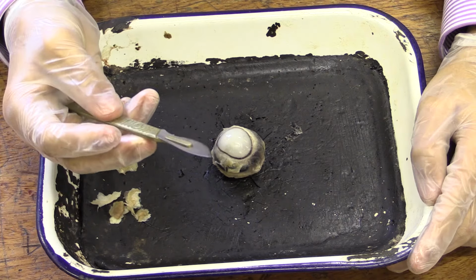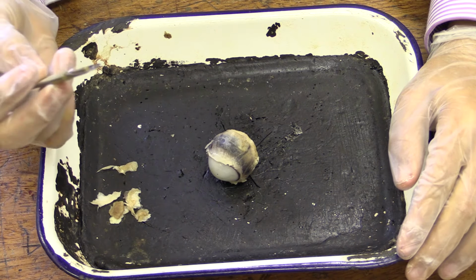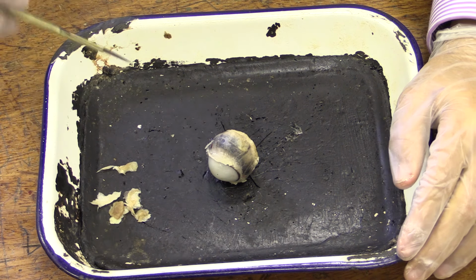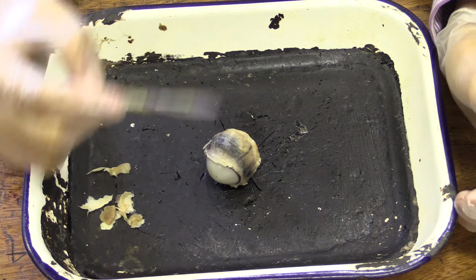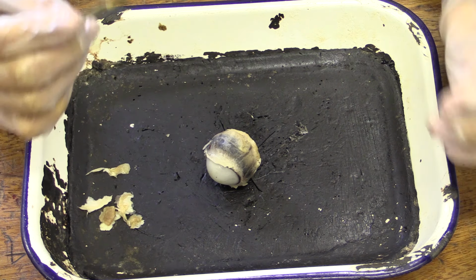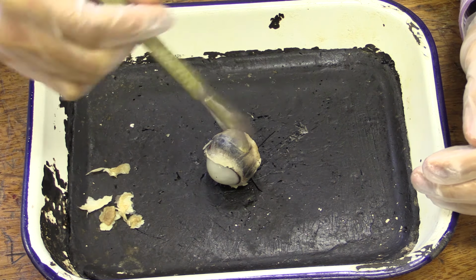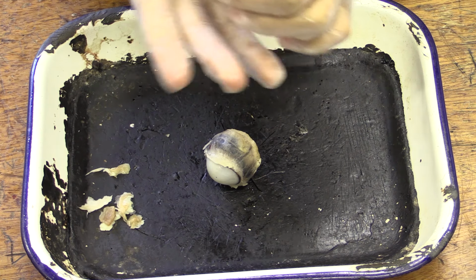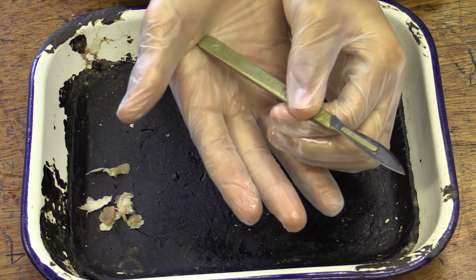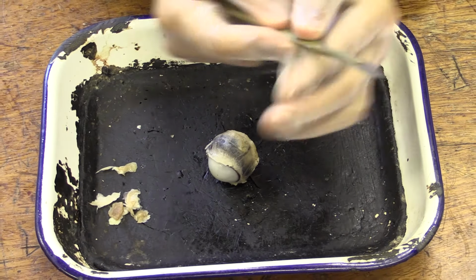Alright, the next bit is that we're going to actually go into the eye. We're going to go into the sclera. We're going to penetrate the sclera and go into the cavities within the eye. But the sclera is quite a difficult and very hard material made out of fibrous tissue. So you can't just use your scalpel and do this. You need to hold it in a special way where you make sure when you put pressure into it, it's not going to slip past like that. So you're going to hold it here and here.